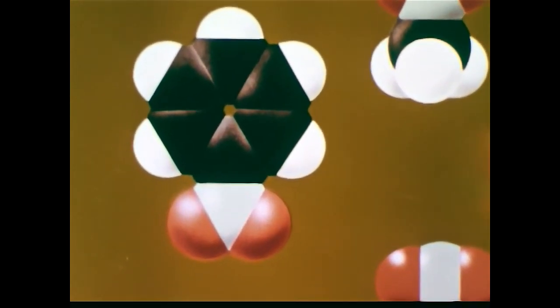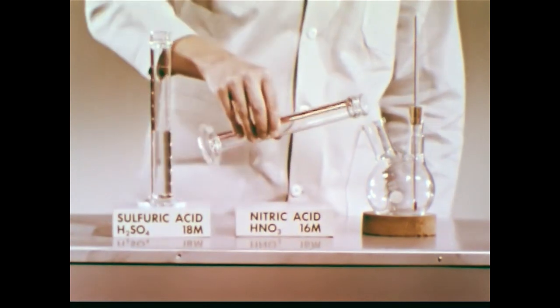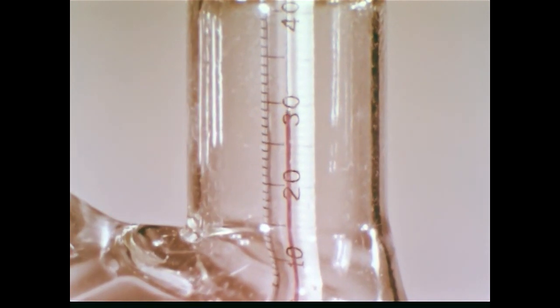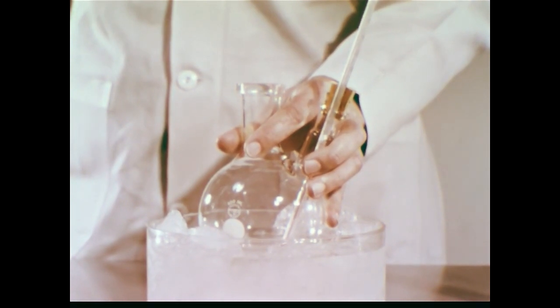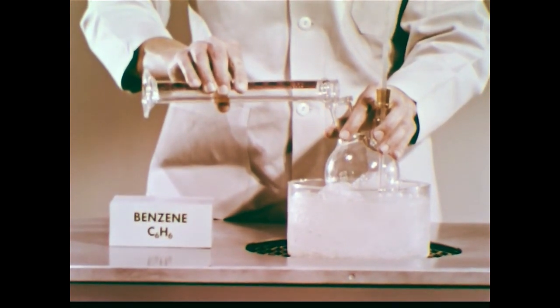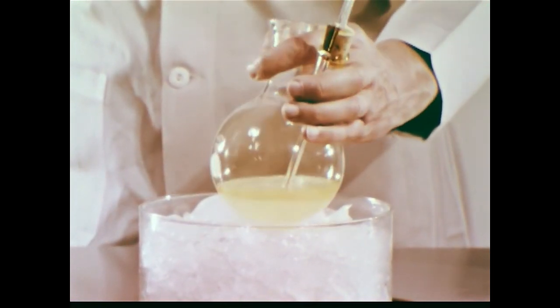In making nitro compounds such as nitrobenzene, we start with a carefully measured amount of concentrated nitric acid. We then add a measured amount of concentrated sulfuric acid. The marked rise in temperature indicates a reaction is occurring. Reactions producing nitro compounds are extremely dangerous — they should be carried out only under carefully controlled conditions and at low temperatures. Next we add a measured amount of benzene to the mixture. Benzene is only slightly soluble in the acids; we must shake to mix the two. Yellow nitrobenzene, the desired product, collects in the upper layer.